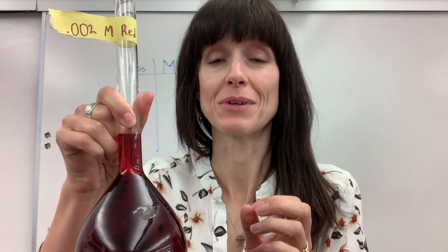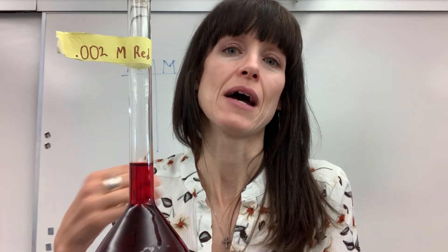Here is the problem. I am going to give my students some Gatorade — a fruit punch Gatorade where the only dye in it is Red 40. My question to my students is: what's the concentration? How much of that Red 40 is in the Gatorade, that fruit punch? So what they're going to have to do is create a calibration curve, a Beer-Lambert plot.